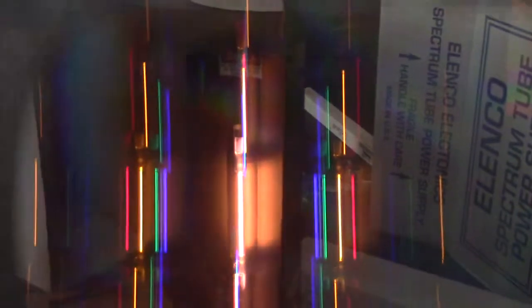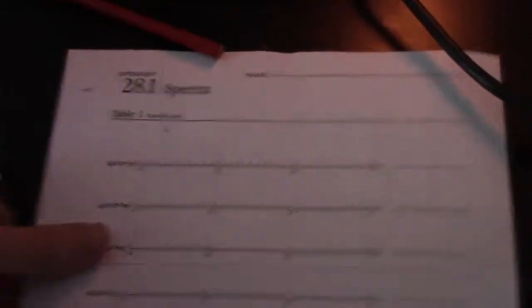So what we're going to do at this point is, I can see them, the blues, the greens, the yellows. I'm going to try and use this spectroscope and see if I can't tell Sam where they are. What Sam's going to do is, this is your data table. Sam is actually going to color in this data table wherever those lines are.